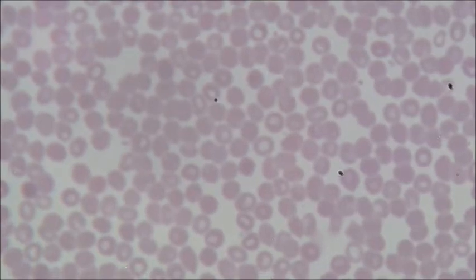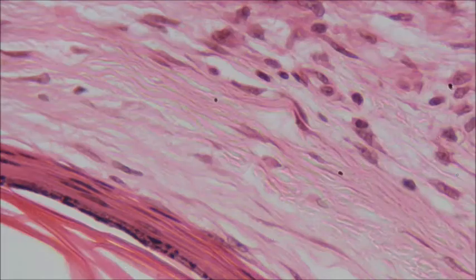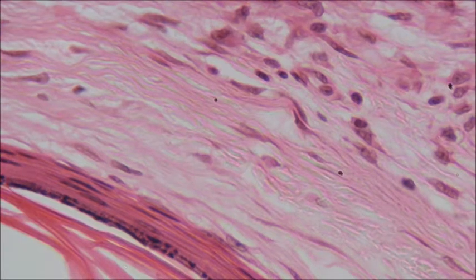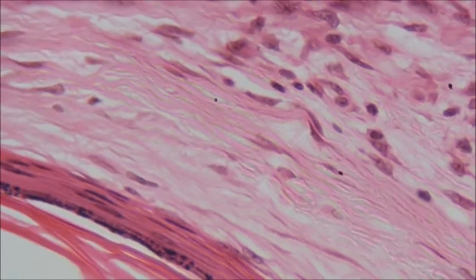Okay, I'm going to show you some human skin next. All right. Ooh, would you look at that? Now you can clearly see a lot going on here. It's kind of hard to decipher, but one thing we can make out, I'm just going to move it a little bit, is those dark dots, which I would assume are nucleuses. Nucleuses are the main organelle that we can see through a microscope.